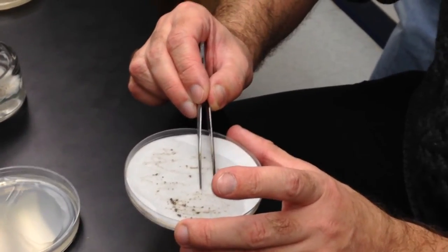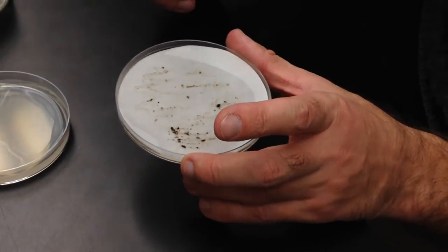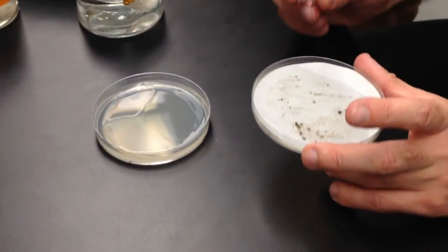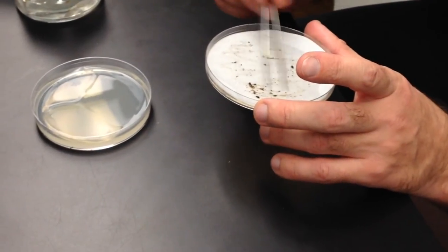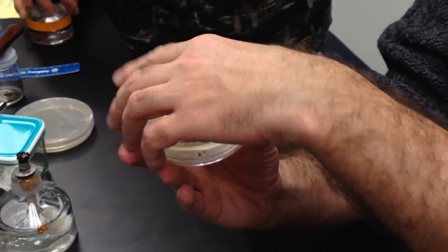So what percent of the poop has it? When I did it, I did 21 samples and one did not work. It worked for both — half from natural habitat, half from pets. And it did not work one time from the pet — it happens, from the food. So this is done, and again you do the same thing. This is the lid now, and you just wait.